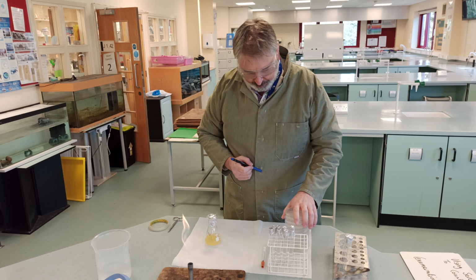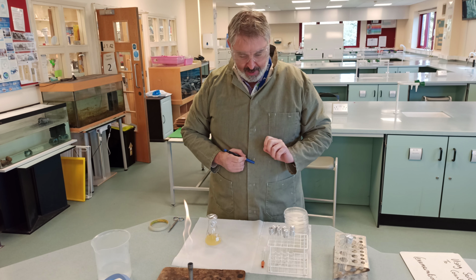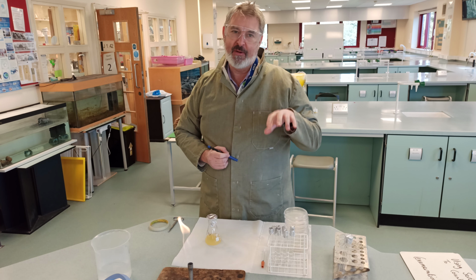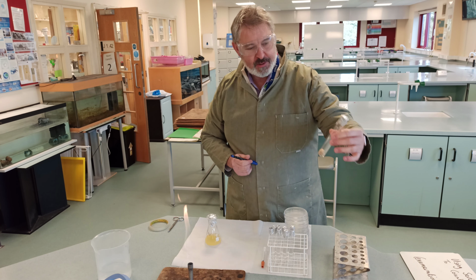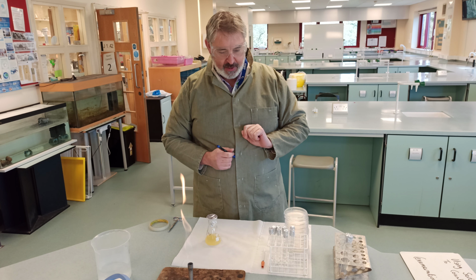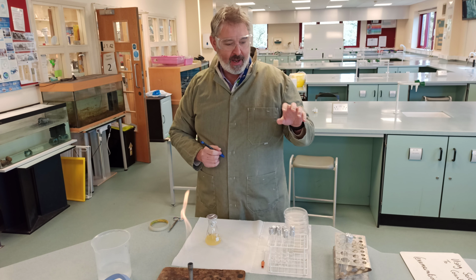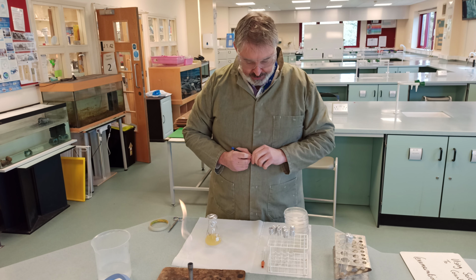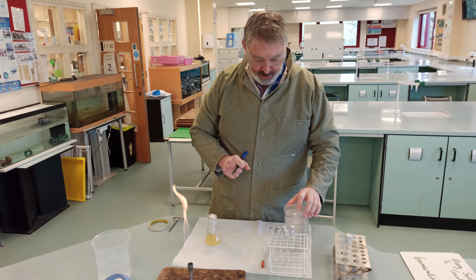Okay, I've got some prepared plates which have got nutrient agar on. I have got some distilled water that has been sterilised in the autoclave, as you saw on autoclave before. I've also got some pipette tips here and a syringe which will enable me to bring up bacteria and start my dilutions. Okay. So what I will need to do first is to actually label up my plates.